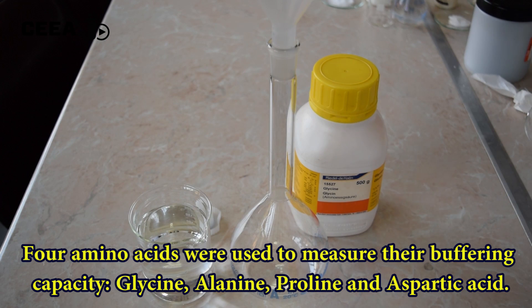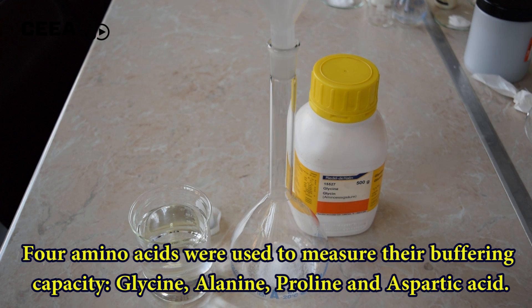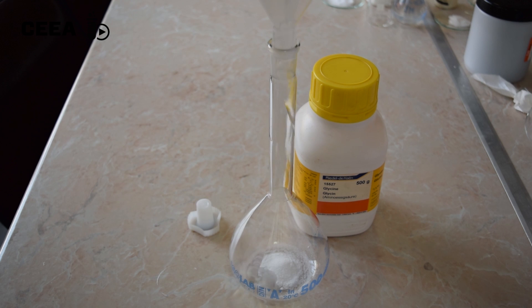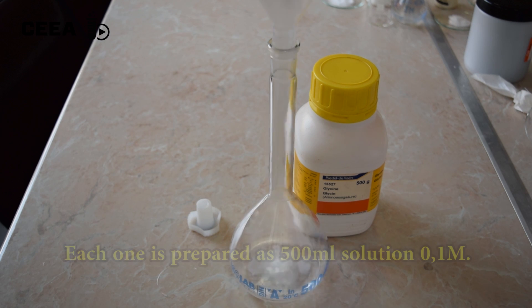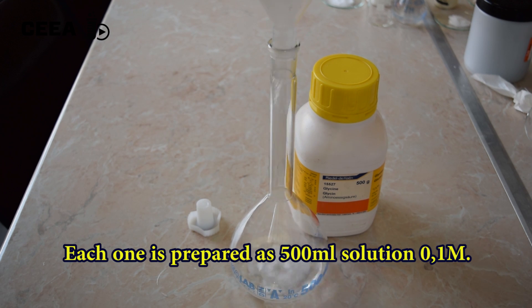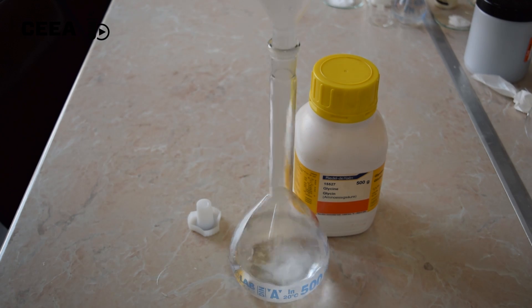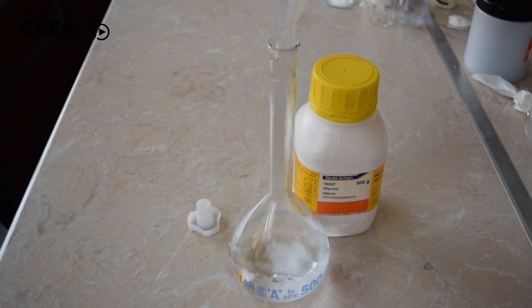Four different amino acid solutions will be used as buffers. From each amino acid, 500 milliliters of 0.1 molar solutions were prepared.